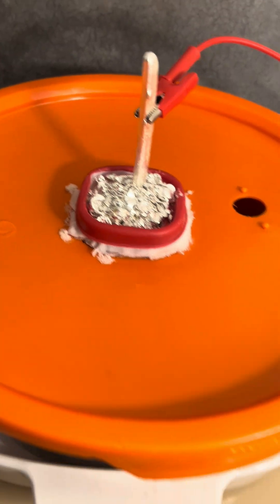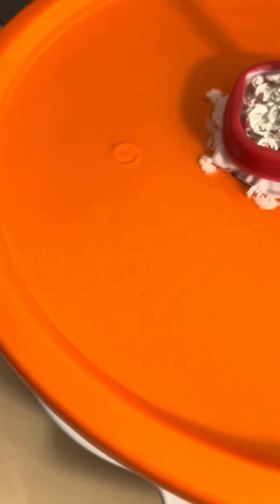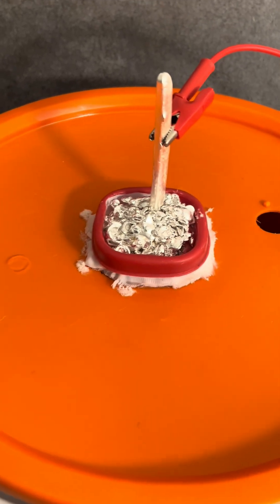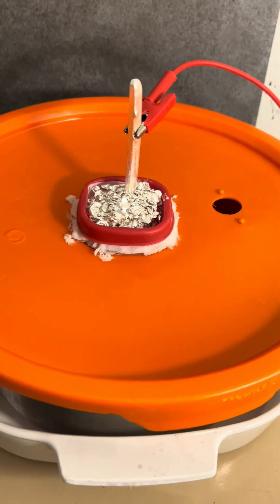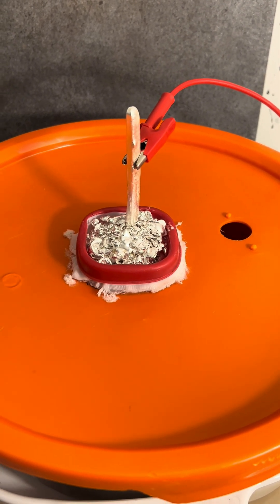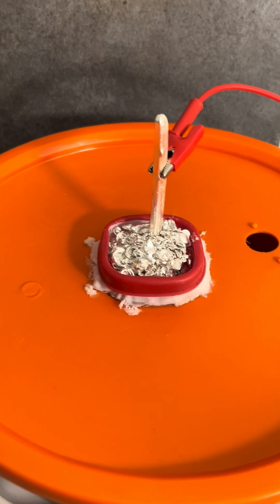And this is how I clean it up. You can see some of this shot is impure — it's got a little copper to it. Some of this cemented out really well, but some of it isn't. We use it to clean up and capture the slimes. I have some examples of silver that is sterling and has a lot more copper. If you hold tight, we'll take a look.